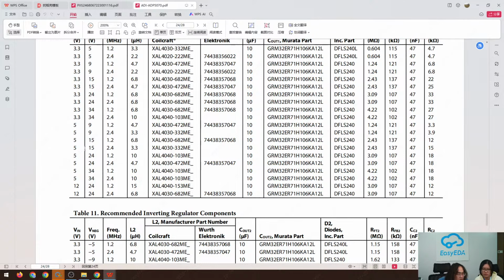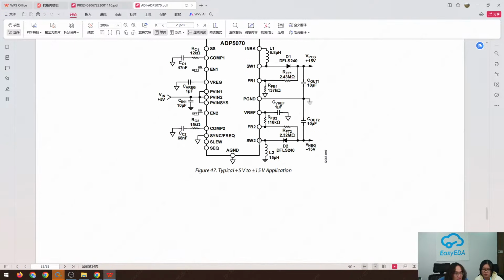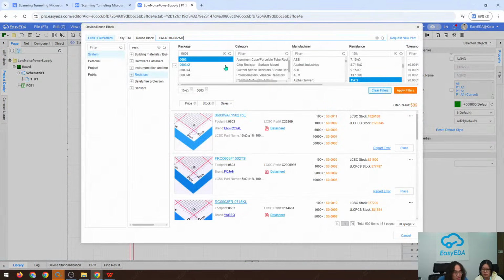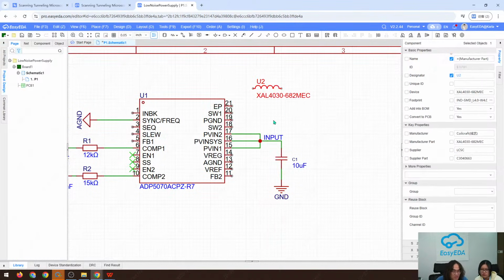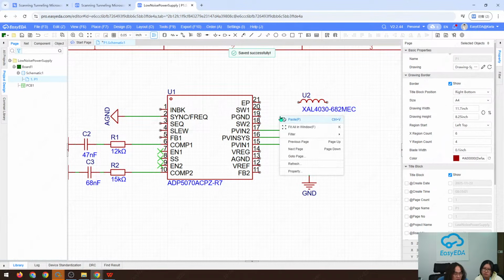Voltage in is here. We can go with this inductor. And again, back to EasyEDA, we can search for it. So this is very convenient. We do not need to draw our package or draw our schematic symbol.